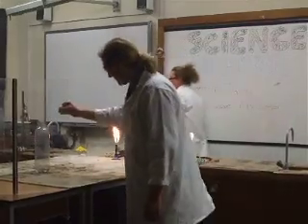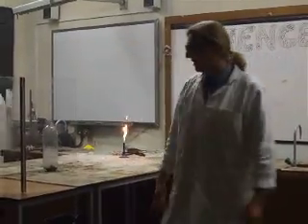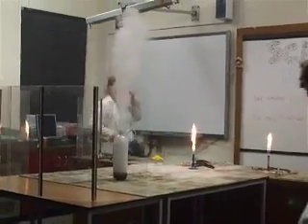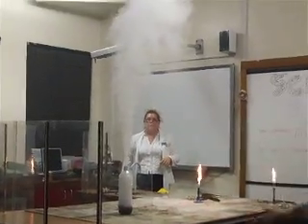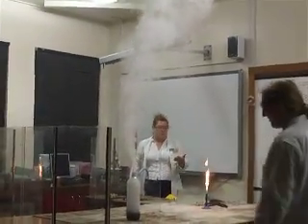This is the catalyst, okay? And it catalyses the reaction. So now it reacts very, very fast. And you see the gas is spurting out the top of it like that. But this type of reaction actually produces heat. It's called an exothermic reaction.